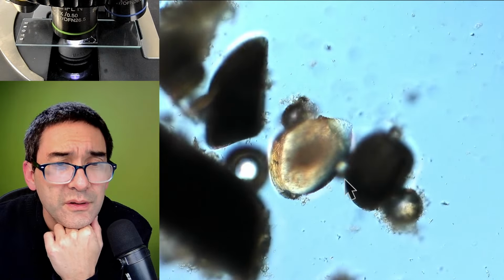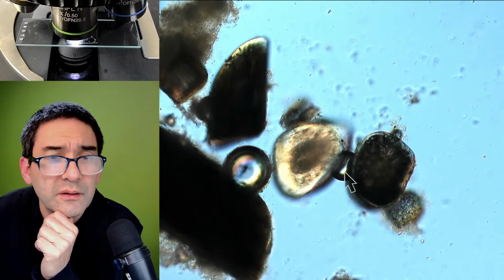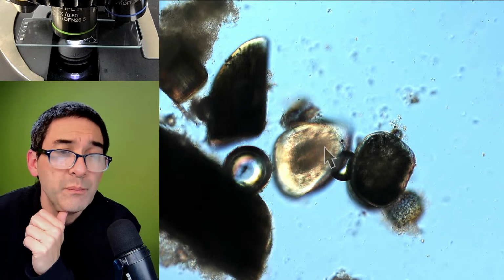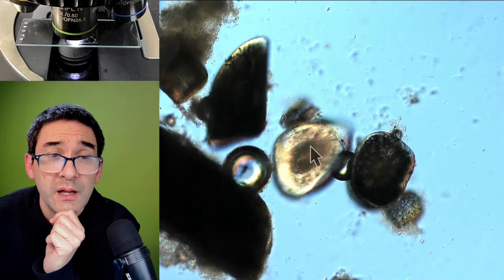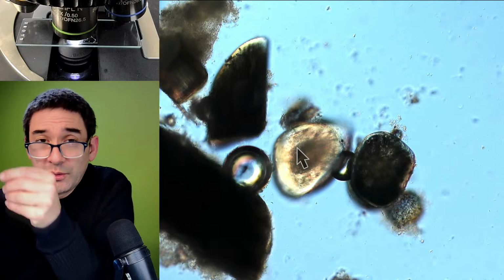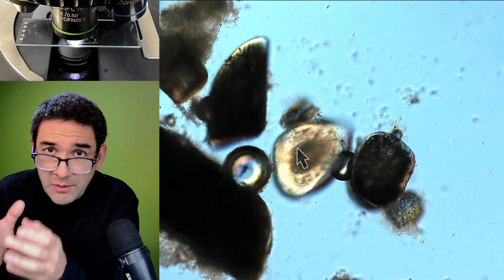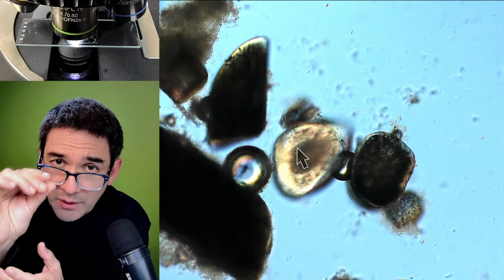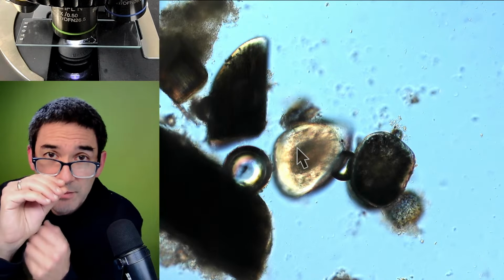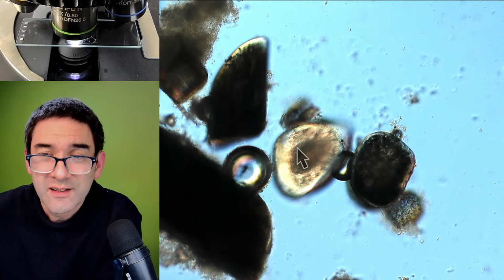Yeah, here it is. It's like a disc. And that is otherwise impossible to actually get a head-on view. Because even if you were to glue a hair vertically somehow on a microscope slide, even a small one would be too dark to see. But here we really have thin, thin slices.